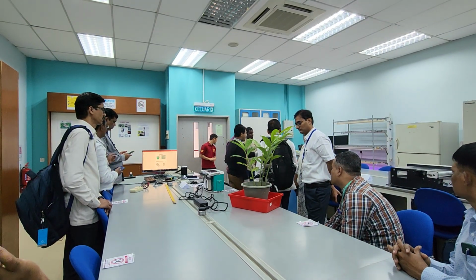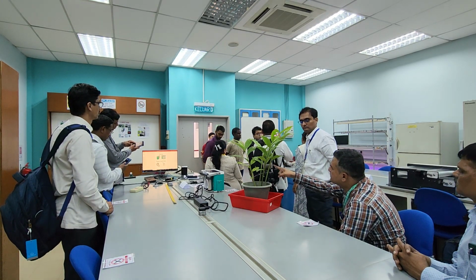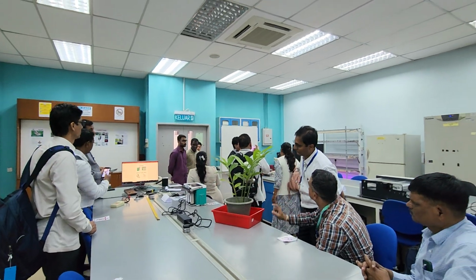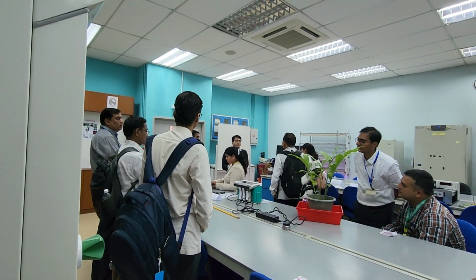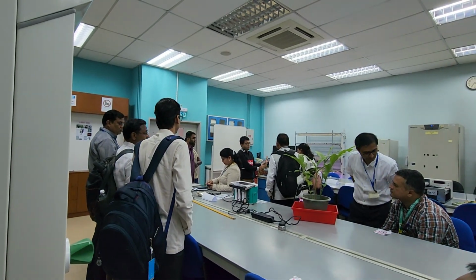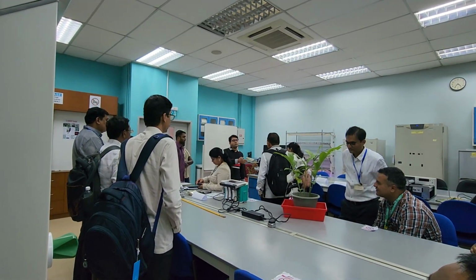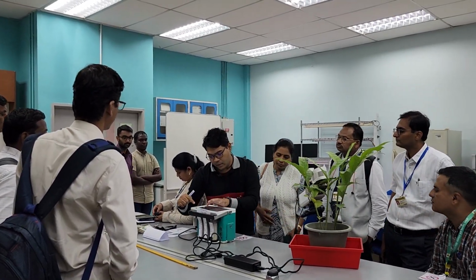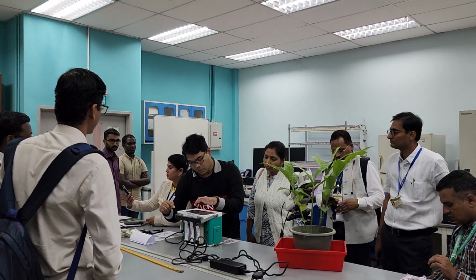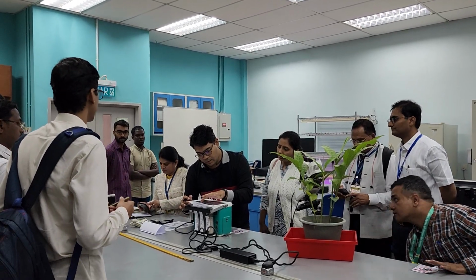This equipment is not full spec. You don't have the fluorescence chamber attached to it. So if you want to study steady state gas exchange, CO2 response, or light response, it's fine, you can use it. But if you want to go for fluorescence or something more accurate, we go to the newer version, the 6800. This one is attached with the fluorescence. If you want to read the fluorescence, it should be number 4 or 5. Oh, the fluorescence reading is gone. Who removed the fluorescence reading in here?